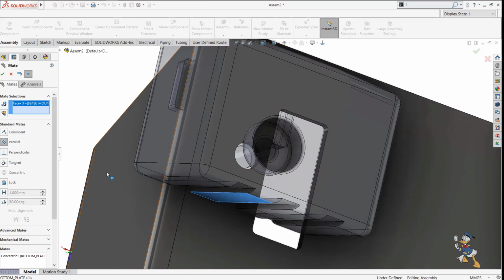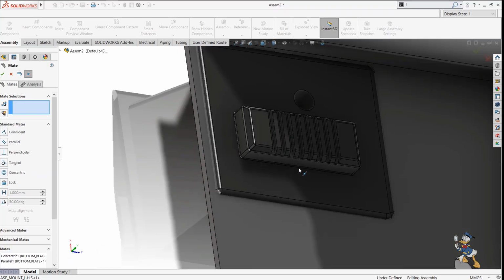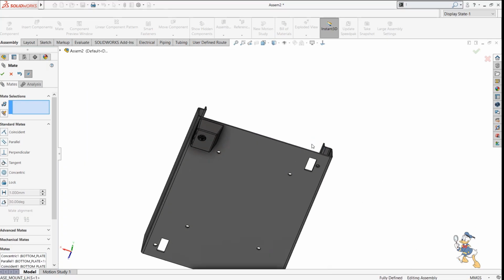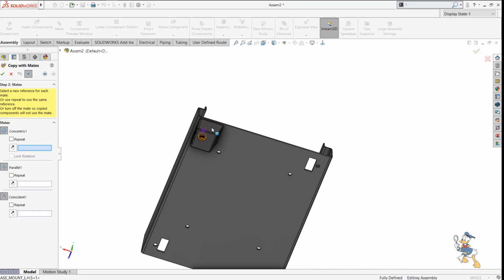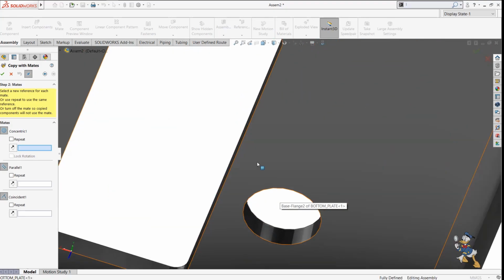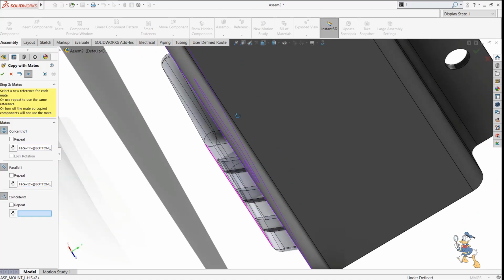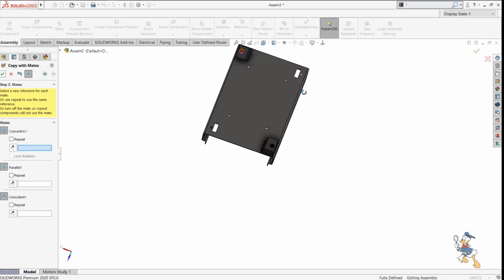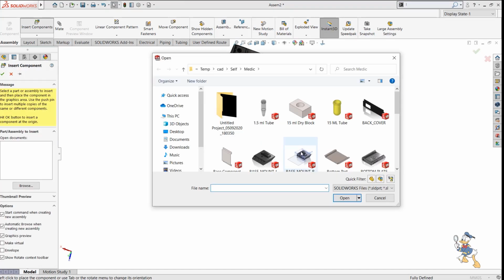Okay, and I will provide some sort of parallel feature to this. It would be like this, and then I just need to select a coincident mate to make things happen. So this is how we can see, and we can place the components easily. We can copy the components by just providing the value to the features, and then it places it automatically. We don't need to select a feature again and place it over there. I can copy those components if we have the same mate value over there.